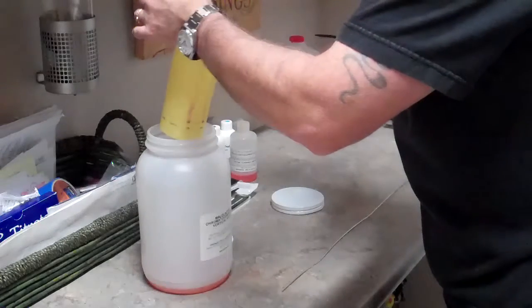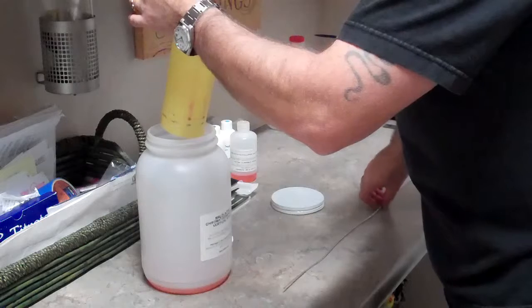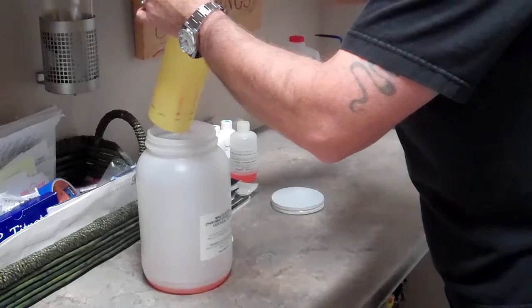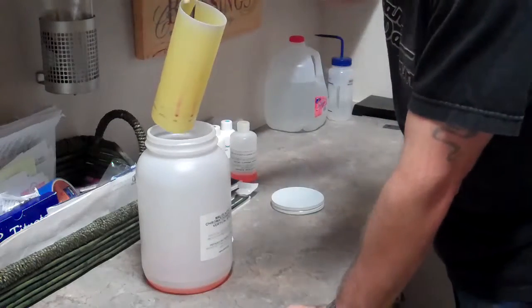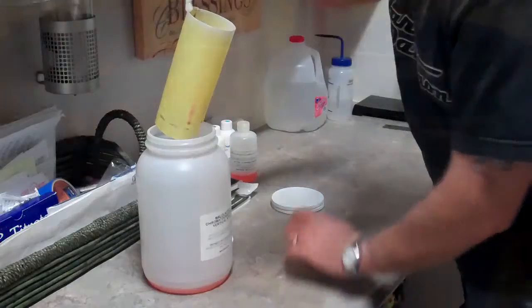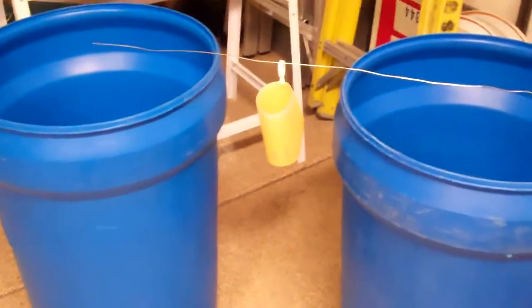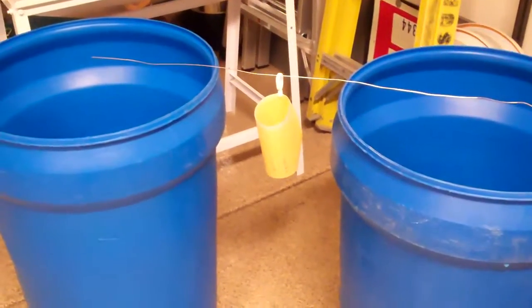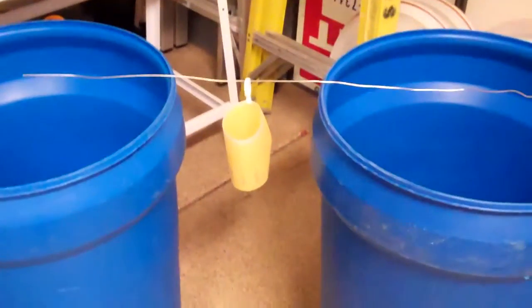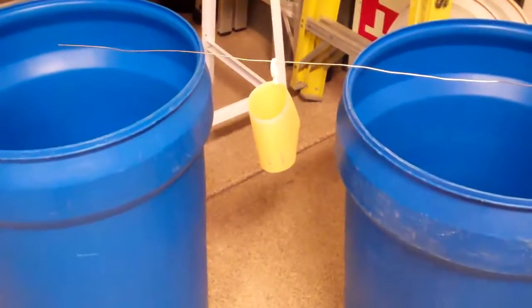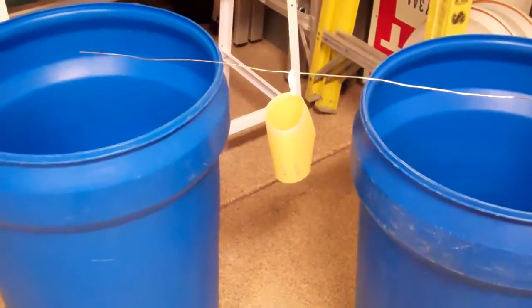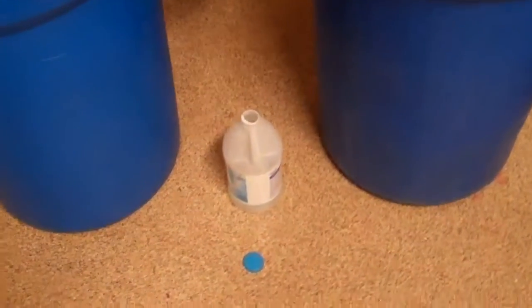I'm just going to grab it and pull it up. As you can see, the solution has wicked up through the entire paper, and we're just going to suspend this on a wire overnight and let it start to dry. I've suspended the chromatography paper by a wire and a clip out in my garage because the smell of that solution, you don't want that in the house.